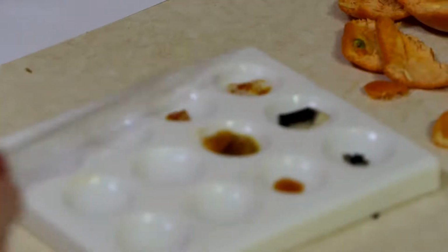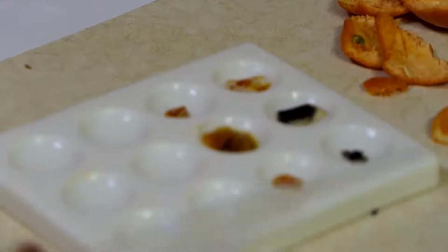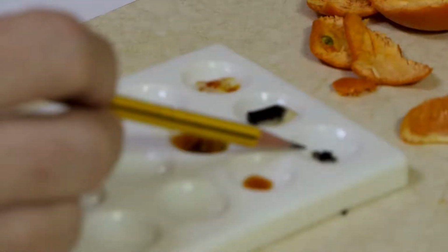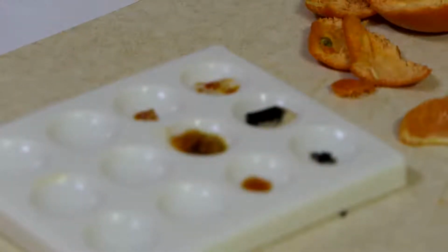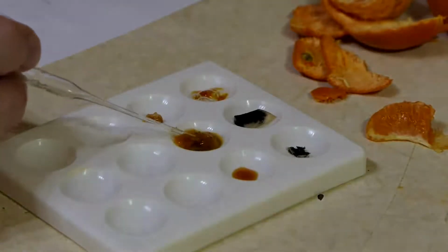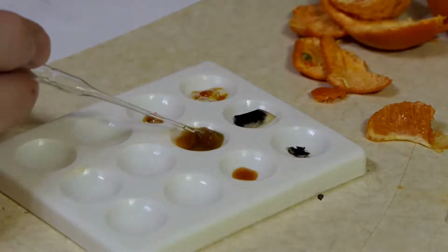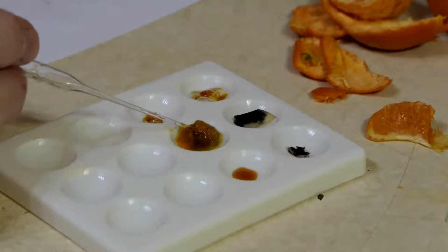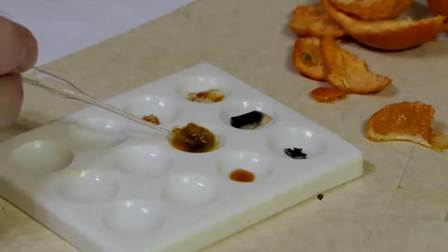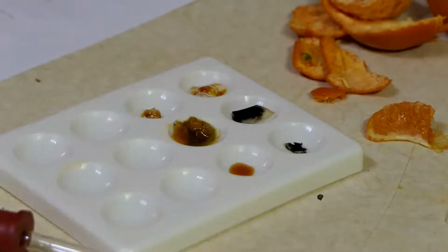My next test with the potato, this has turned black, so this is positive for starch. The crisps has done exactly the same. My cheese, that's still orange. My satsuma, on the other hand, I think I've got a few little bits of black in there. It's certainly not orange. It's not that brown. We've got some black in there. So it looks like cheese is a no, but satsuma seems to have some starch in it.